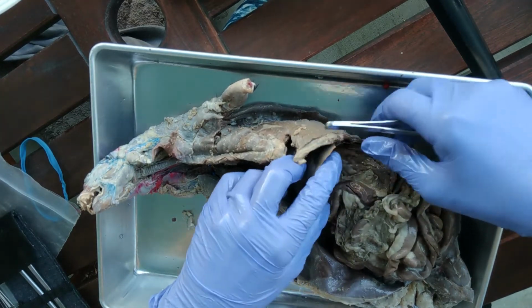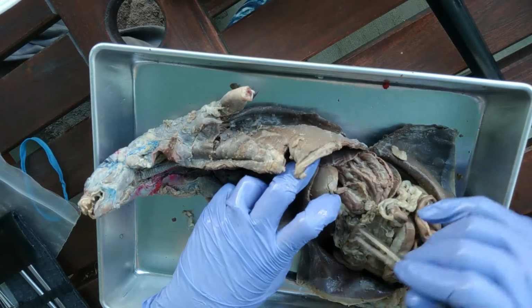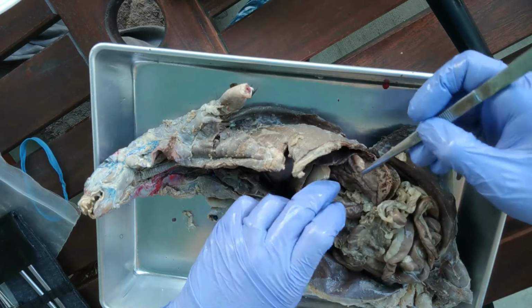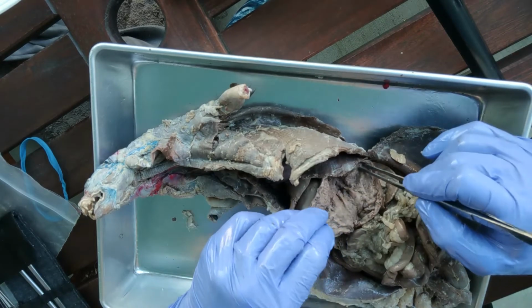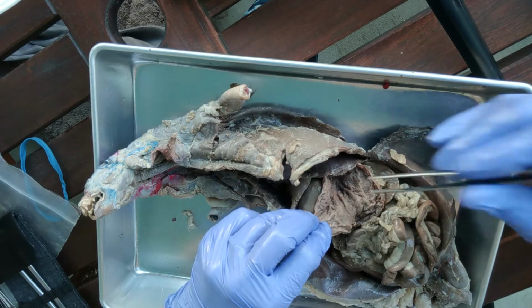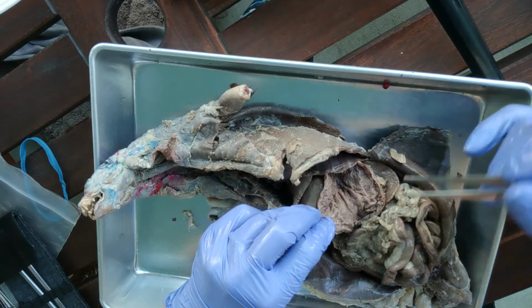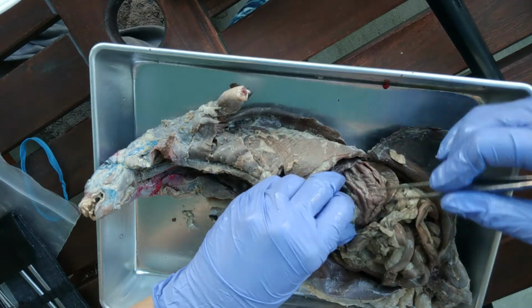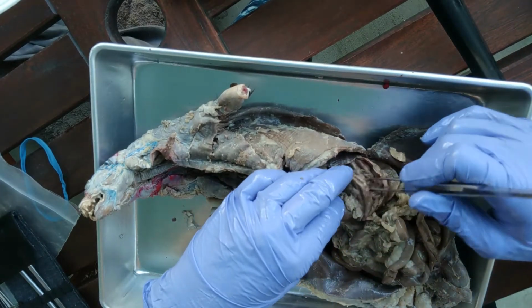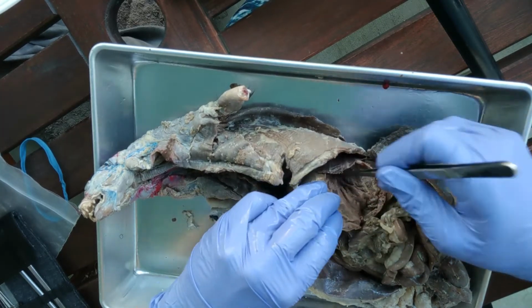Now underneath the liver we have the stomach. Okay, so the liver kind of goes off to the right side, so off to the left side we have the stomach. And I've actually opened up the stomach so we can look inside. And inside of the stomach, we have these little folds. Those folds are called rugae. And the function of those folds is that when the stomach fills up with food, those folds will flatten out, and that allows the stomach to have considerable expansion, and that's how you can really stuff a lot of food.